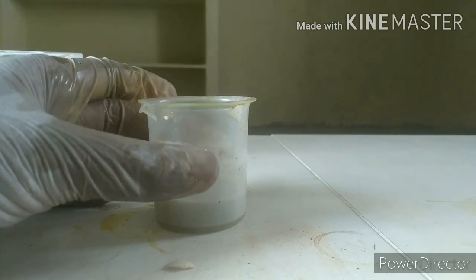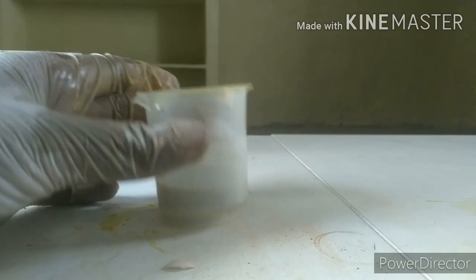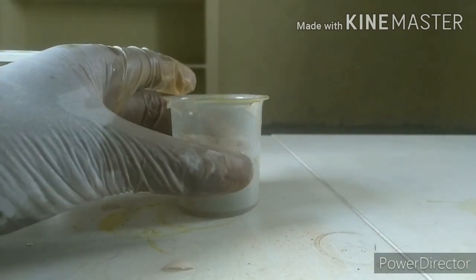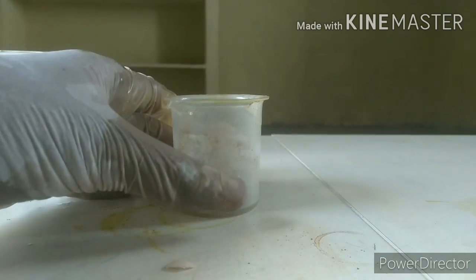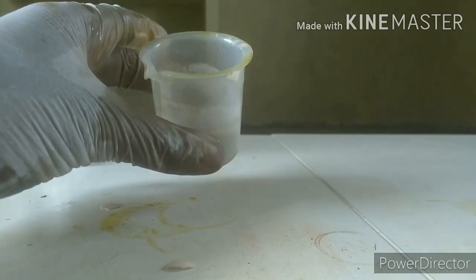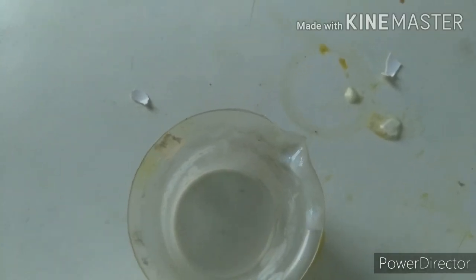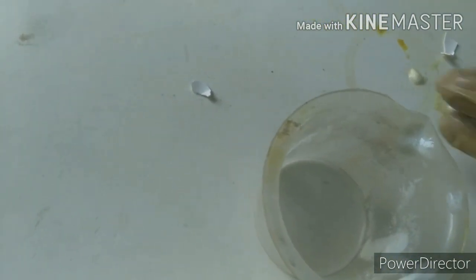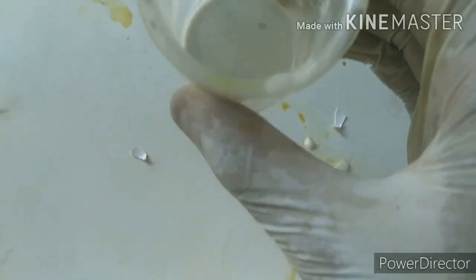I'm going to be getting this filter. You can smell this as some kind of calcium smell, you'll be getting some fresh air smell, some odor like that. I wash this off with a lot of water to get all the sodium chloride out of it because it is soluble in water and this is insoluble, hence it formed a precipitate and it's a bit solid.